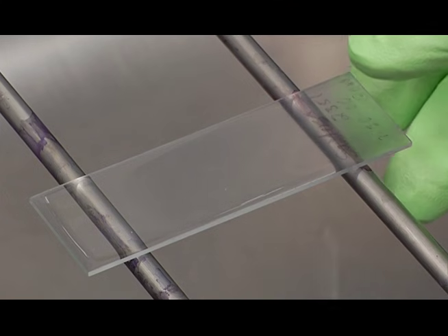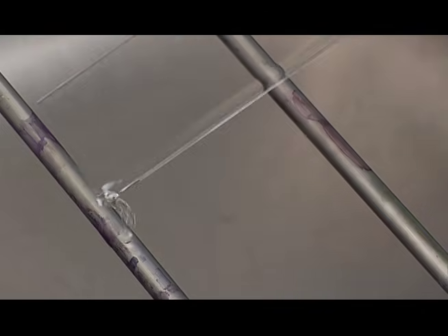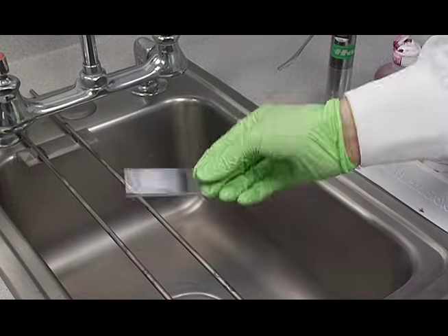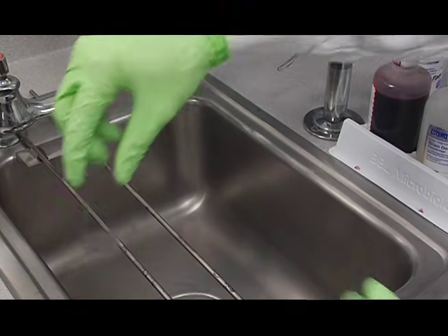After 10 seconds, pick up the slide and shake off the methanol, and put the slide in your rack to dry.